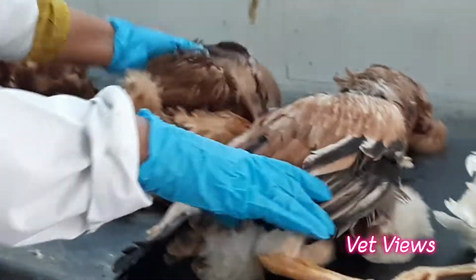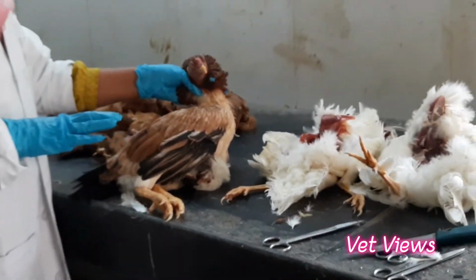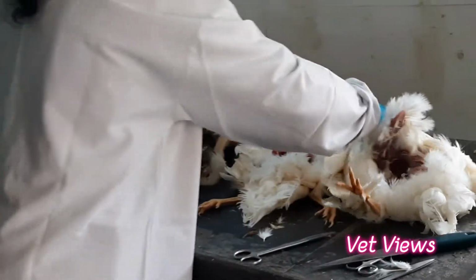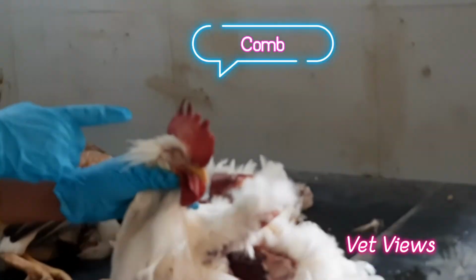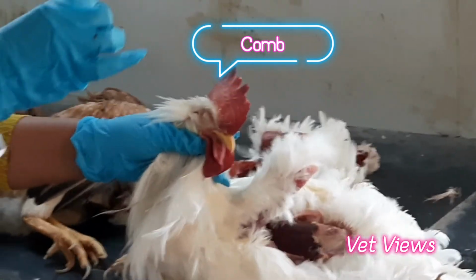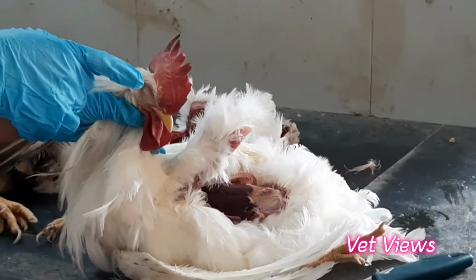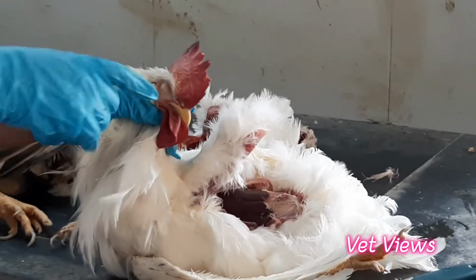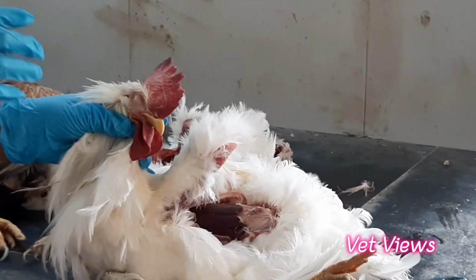So the other organs when you start: the comb and beak are the important indicators. Here, this is an adult male comb, and this is a healthy comb. It should be highly vascularized and dark pink in color. Because of the postmortem changes, it has become very dark; otherwise, it will be this color. Any comb cyanosis or pox lesions, you can observe here.